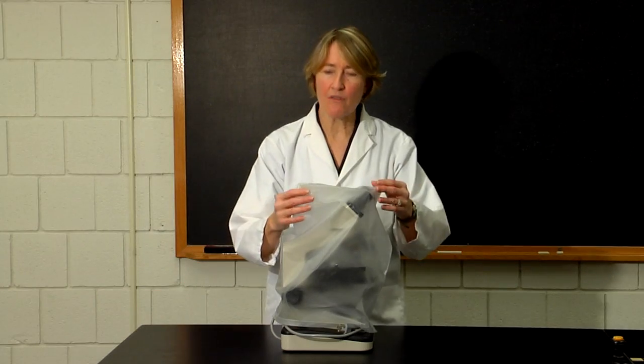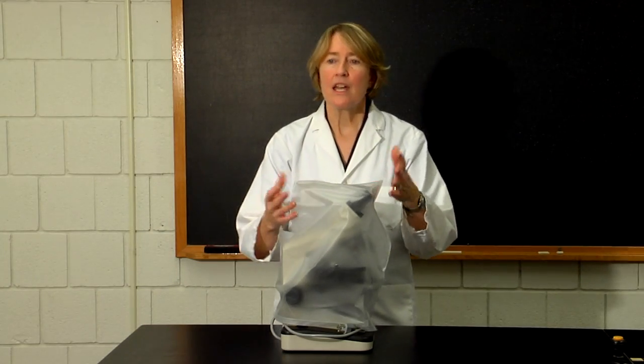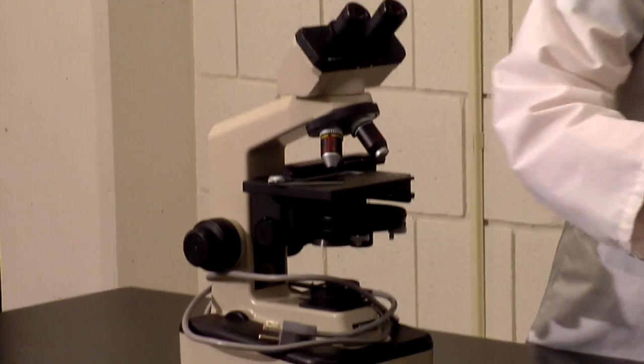The microscopes will be covered with a plastic dust cover. You should remove the dust cover before you move the microscope.